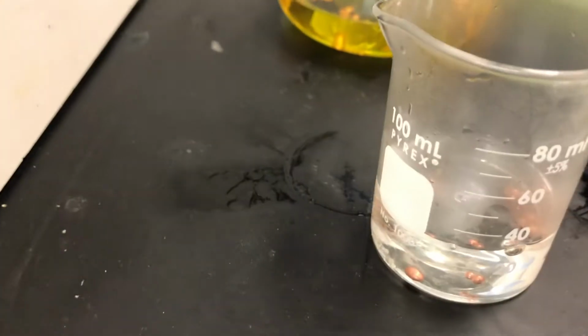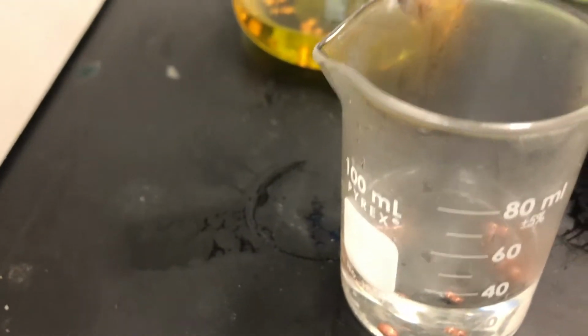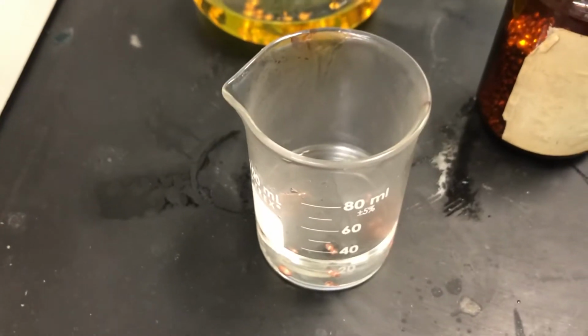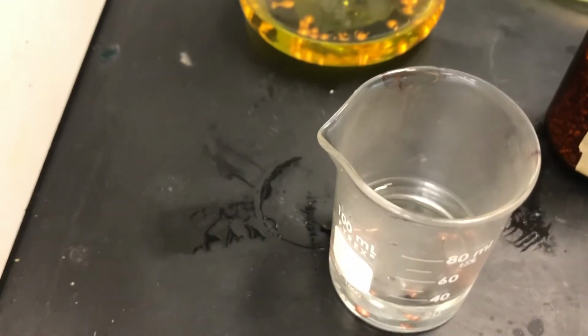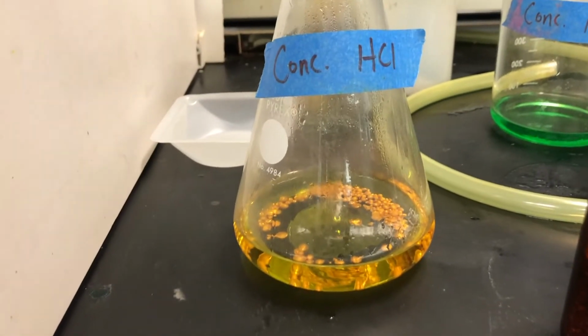Here we go. You might say I threw away my shot. Oh, I just messed up that joke because this is also called copper shot. One of the interesting things about chemistry is time is everything. So if we let this react long enough, this has been reacting for a couple of days, you see, it looks like that.